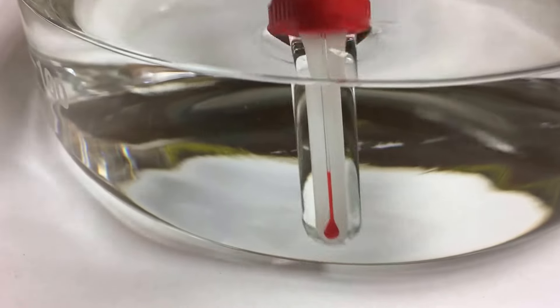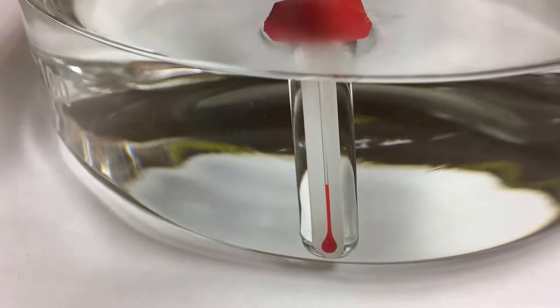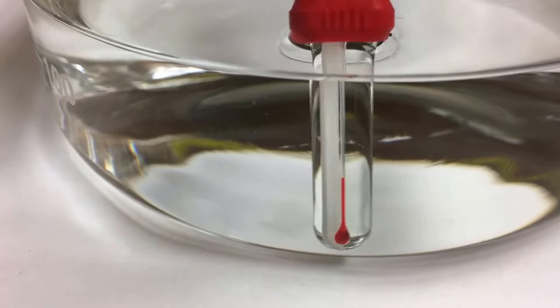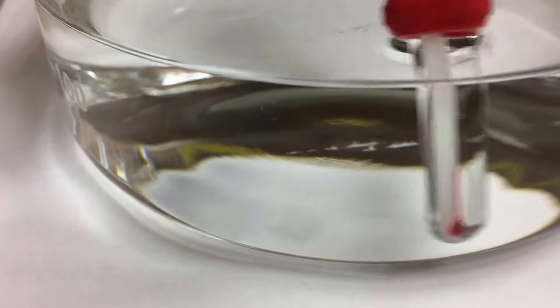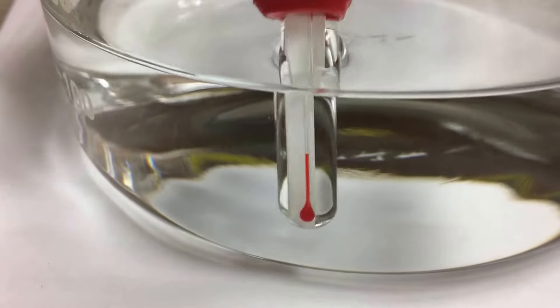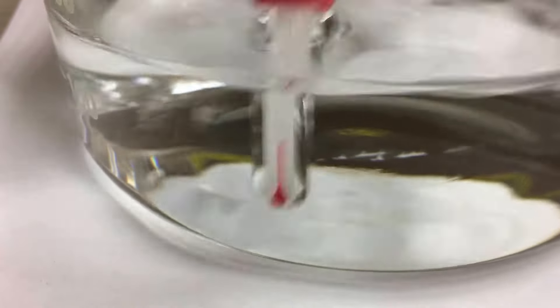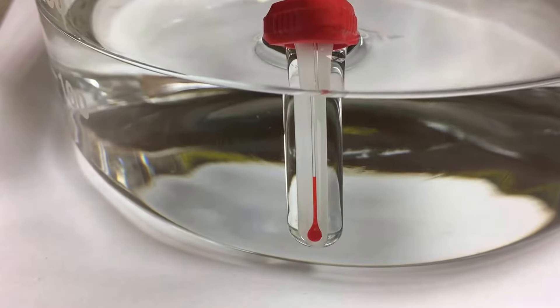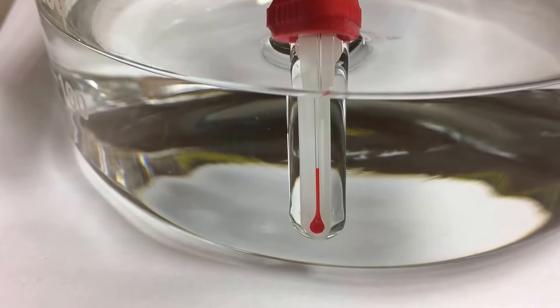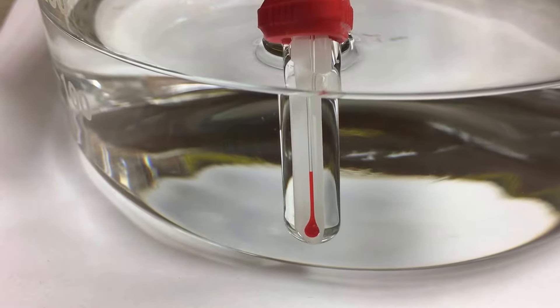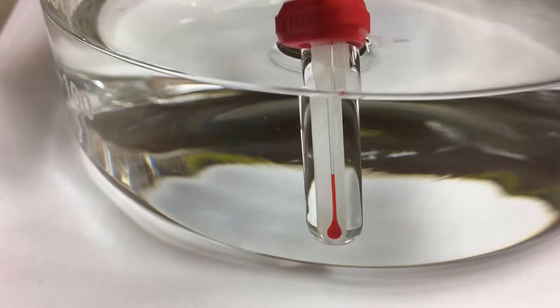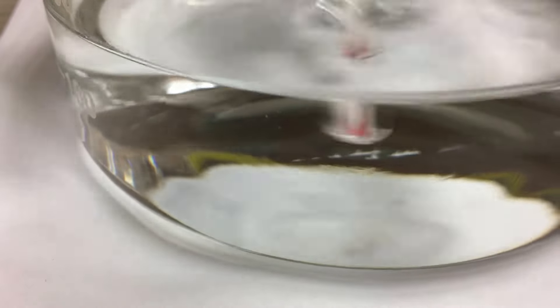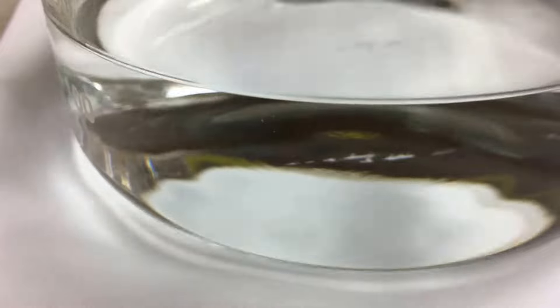It looks like it's expanding, but the whole thing is not going up. You can see I just inverted the thermometer into this hot water. Let it go for one minute. This took us to no change. Probably this one is broken and cannot be used.